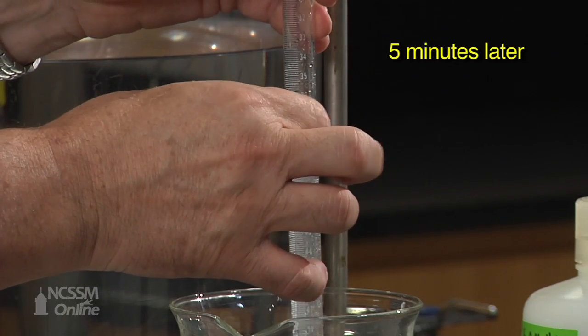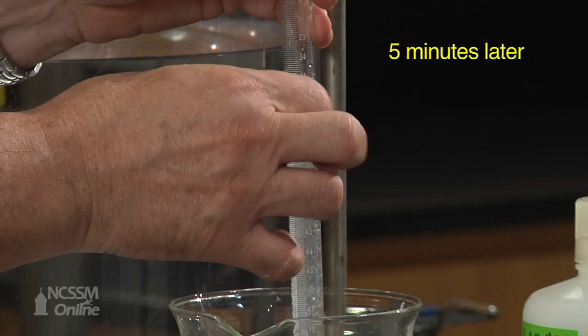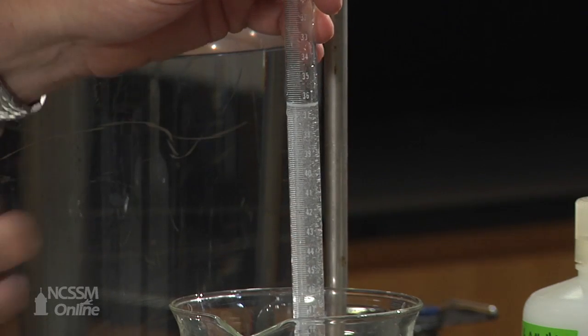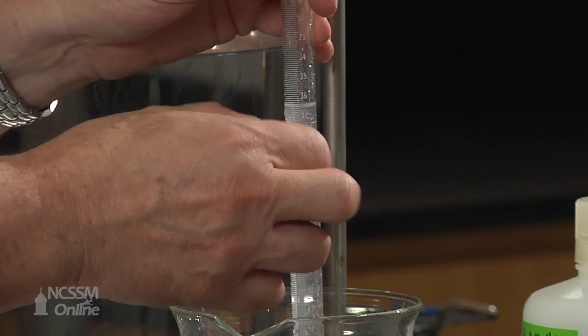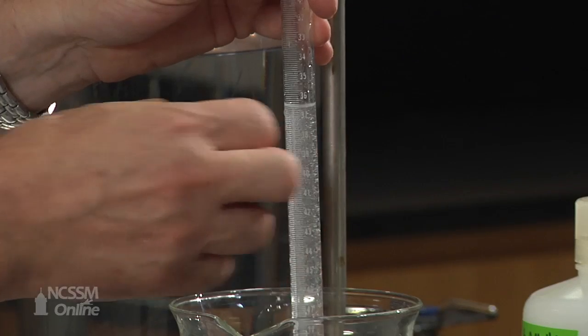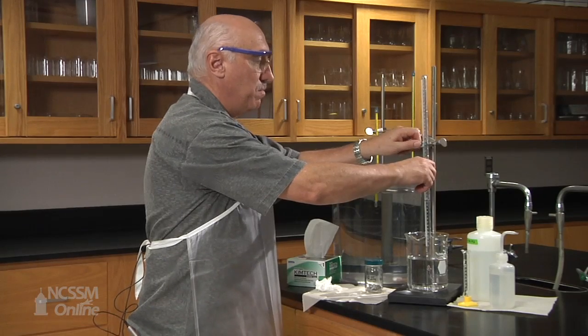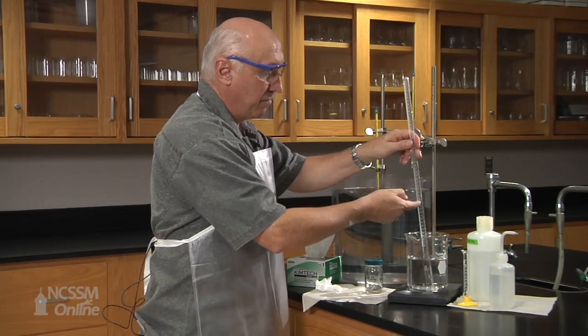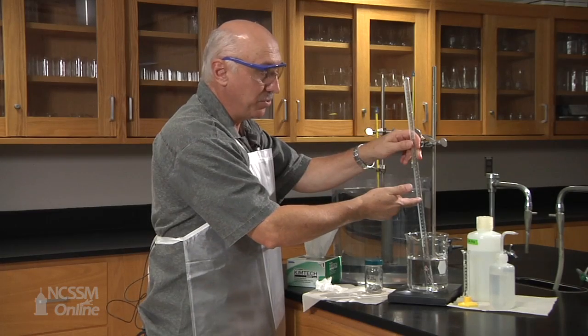So I want to tap it a little bit to make sure that all the magnesium is reacting and all the bubbles of hydrogen gas have come up. Now, after the reaction, we're going to measure the volume of hydrogen produced.